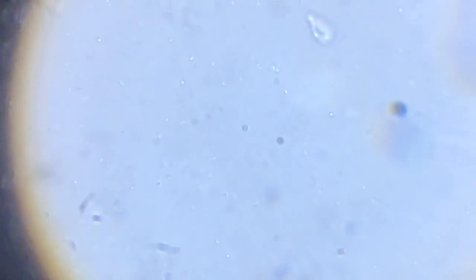We are about to witness the death of a ciliate live, and we shall be watching it dissipate into elements right here in front of us.